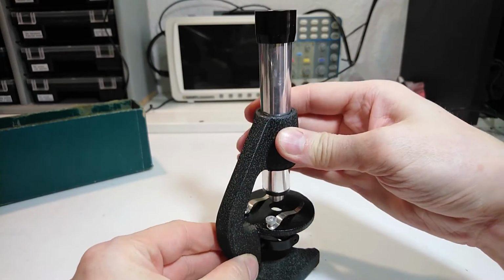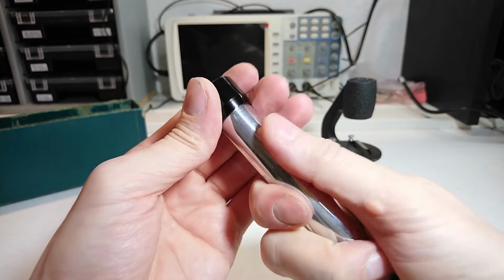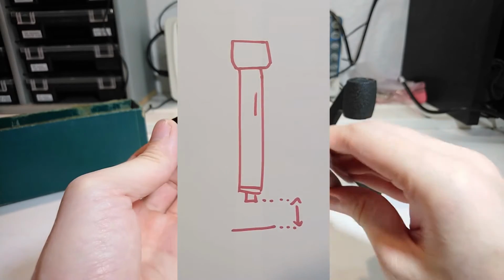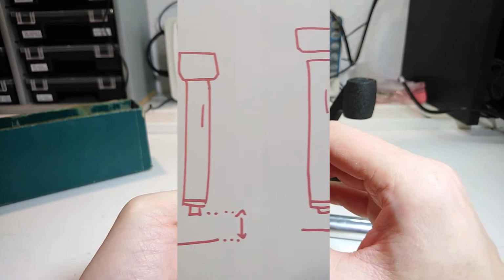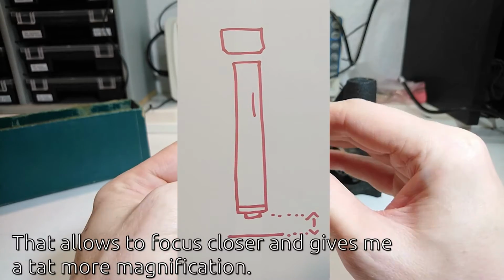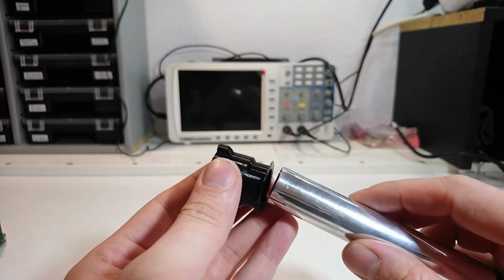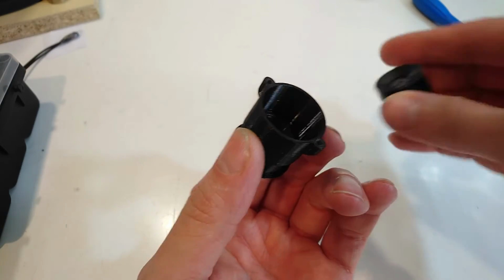Next, I need to make a microscope adapter to hold the camera in place. The ocular of the microscope just slides onto the tube. The distance between ocular and objective has some influence on the magnification, and I decided to design the adapter in a way that the ocular is placed a bit higher. The adapter has a lower tube that is a good fit on the microscope tube, and an upper compartment that fits the ocular.